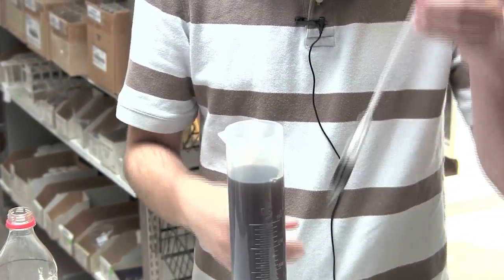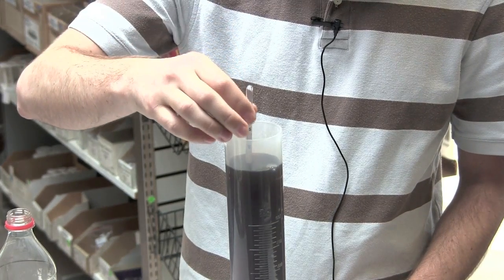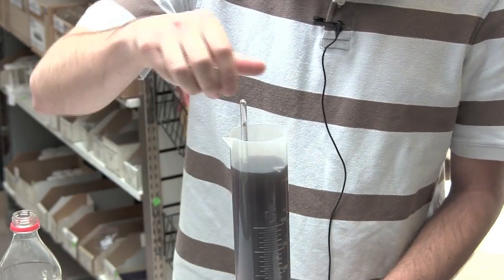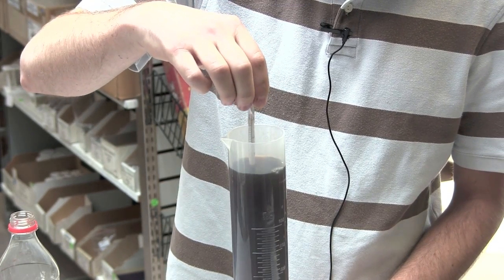Next take your hydrometer and gently set it in the beverage. Turn the hydrometer slightly to release any bubbles that may have been trapped underneath the hydrometer.